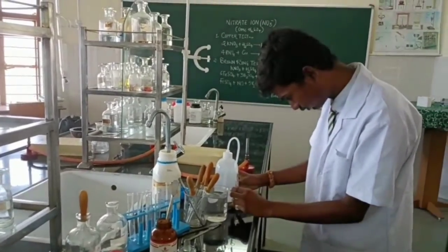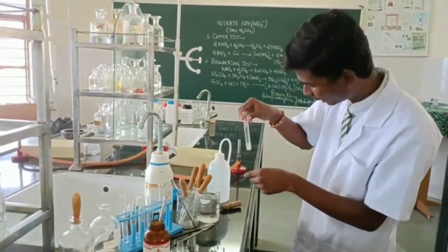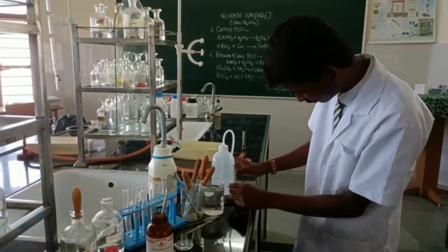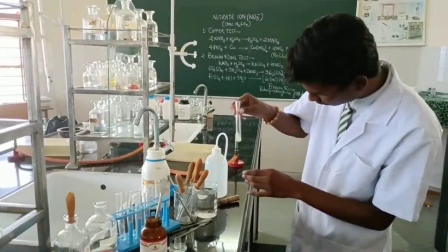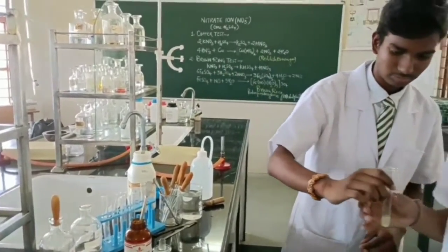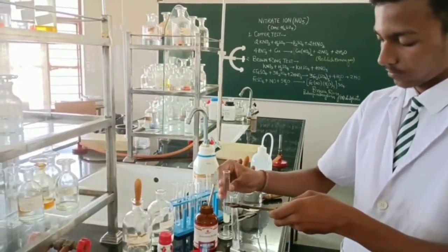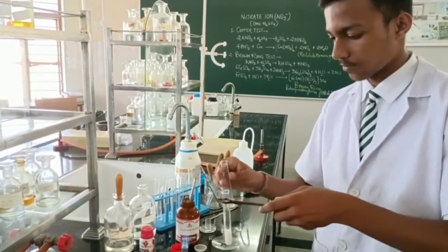So how are you preparing the ferrous sulfate solution? I have taken the ferrous sulfate and am adding the water. Water, yes. Distilled water or normal tap water, but if you take distilled water, it is better. So your solution is prepared? Yes, ma'am. Okay, give it to Tilak. Tilak, come forward. Now Tilak will add this ferrous sulfate solution to the aqueous solution of the salt, and shake the test tube.